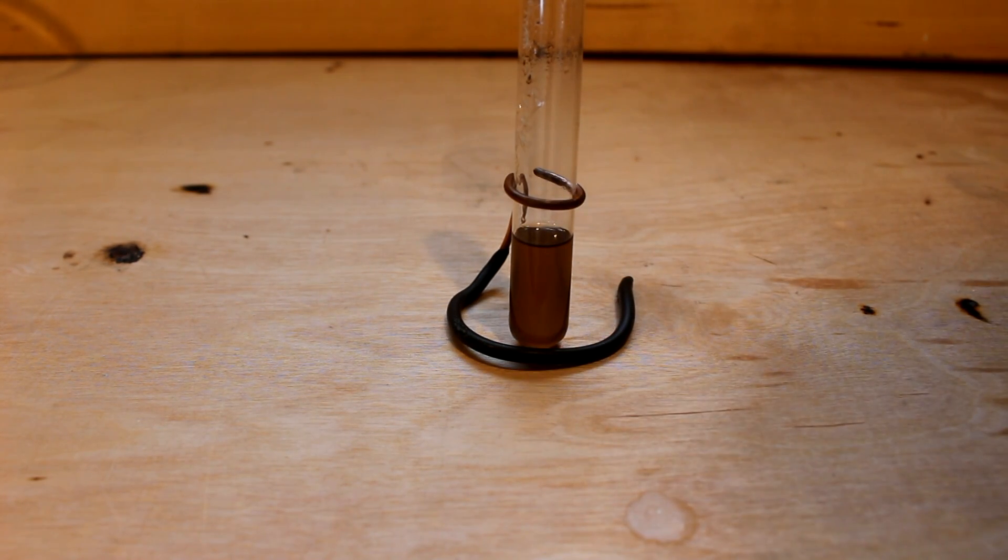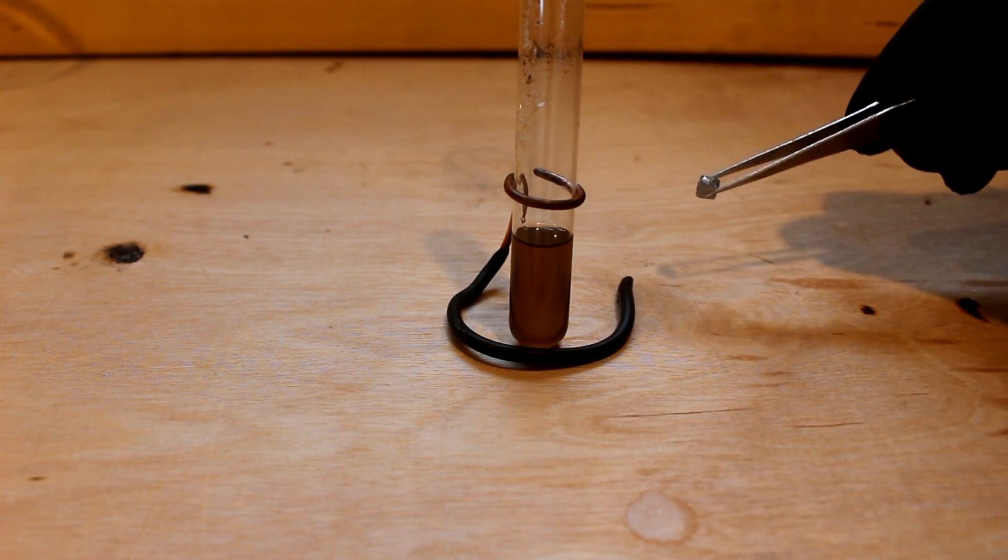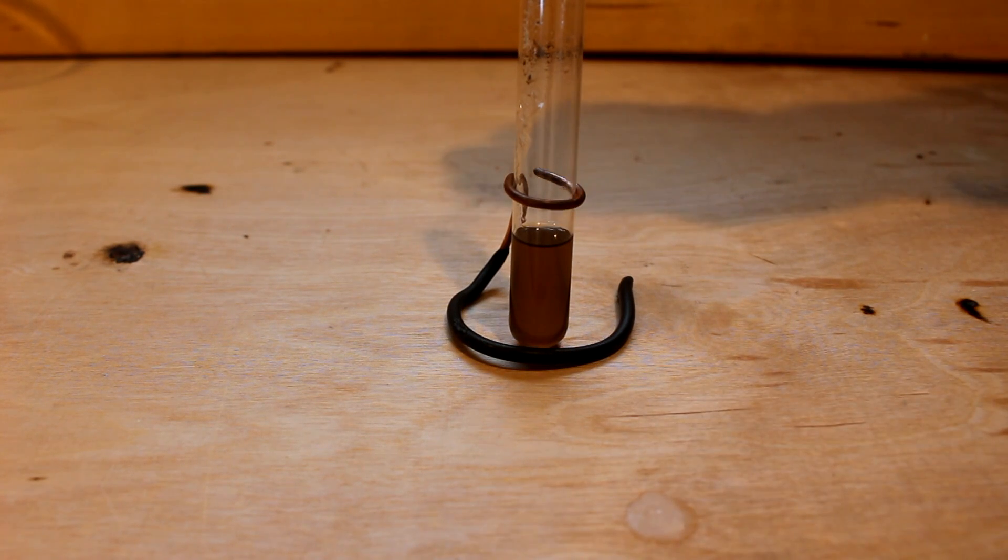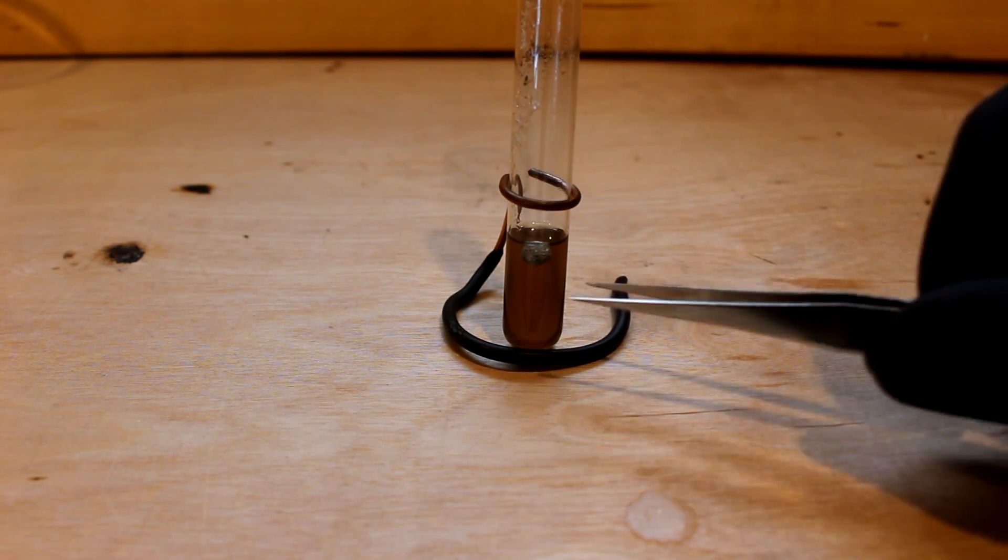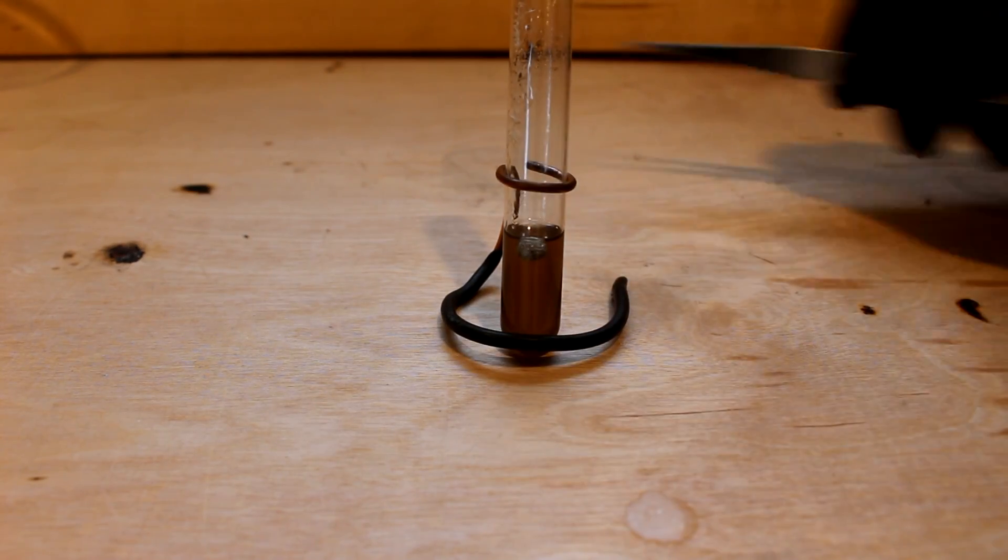Anyway, let's take a diamond and put it into the solution. You remember a diamond sank in the cesium tungstate? Let's see what it does in this thallium solution. There you go. Diamond floats.